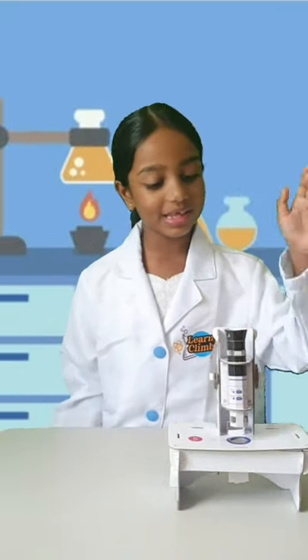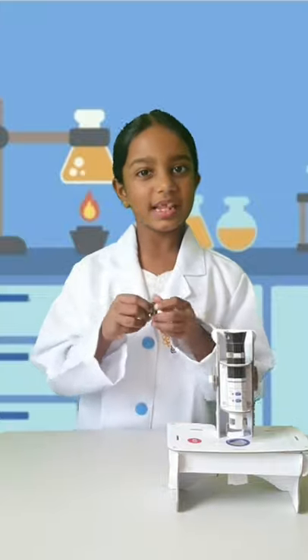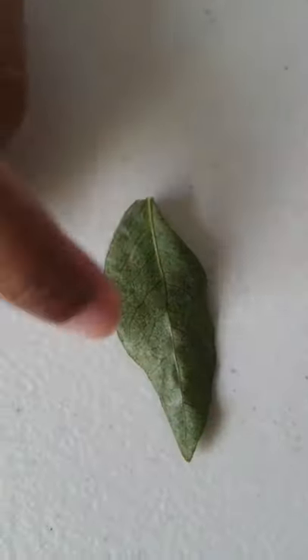Today we're going to be seeing what we can see through the microscope. I've got a leaflet. Let's see how we can see it through our naked eye. And that's what we can see.